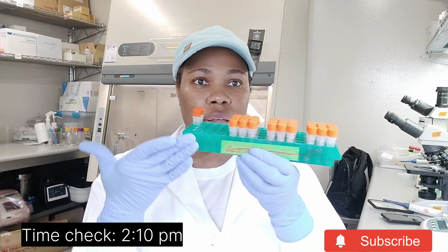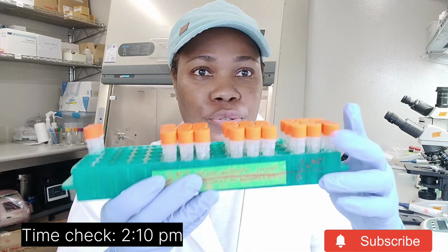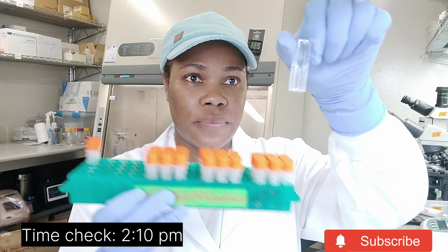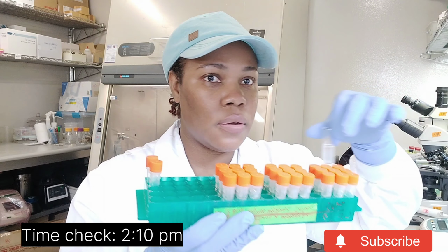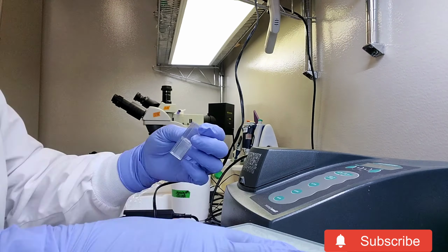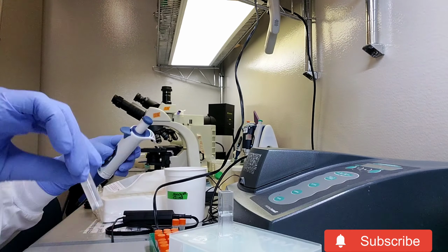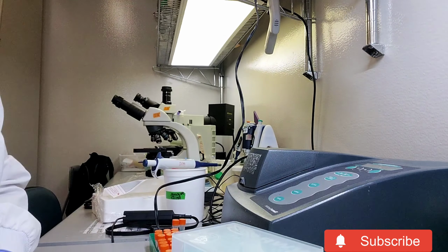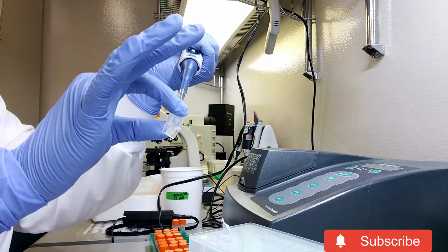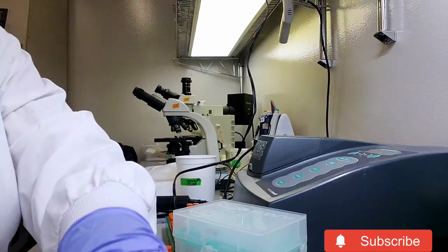So I'm finished transferring them into these 2 ml tubes, and I'm going to put everything into this. This is a cuvette, and then take the reading. So I'm going to use spectroscopy via the spectrophotometer, which is the machine, to note the concentration of all the samples based on nutrition and light conditions. So, the spore suspension. So I have to blank with water, just to get a 0 reading. Once that's done, then I will load all the samples one at a time and record what the concentration of the spore suspension is, and then use that further in my report and my presentation.